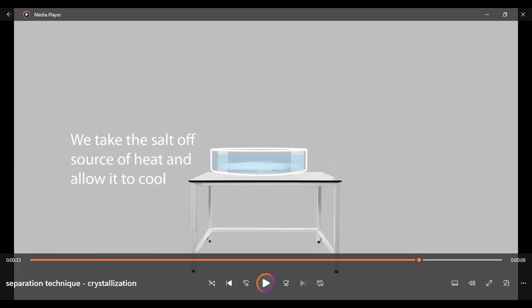Now, I decided to use a glass container here. It's not glass we use in the lab. There is a special thing used for this, a ceramic plate actually. I just want us to be able to see what is happening. That's why I decided to use glass here. Okay, so look at it. You see the crystals of salt are already formed.